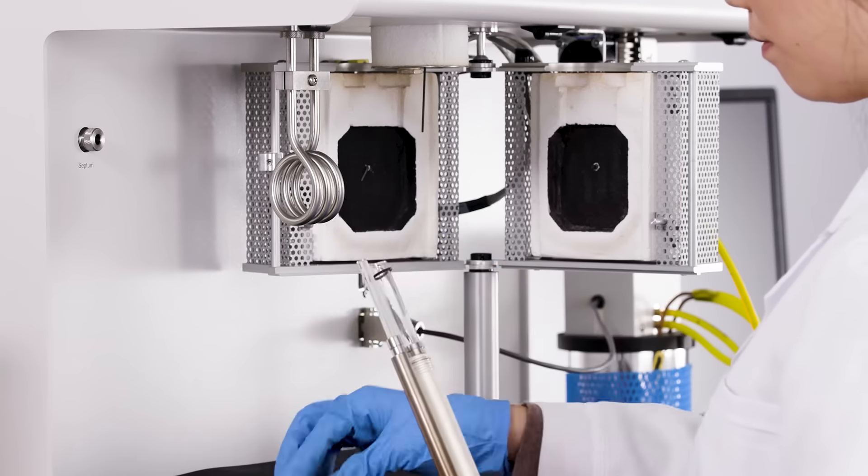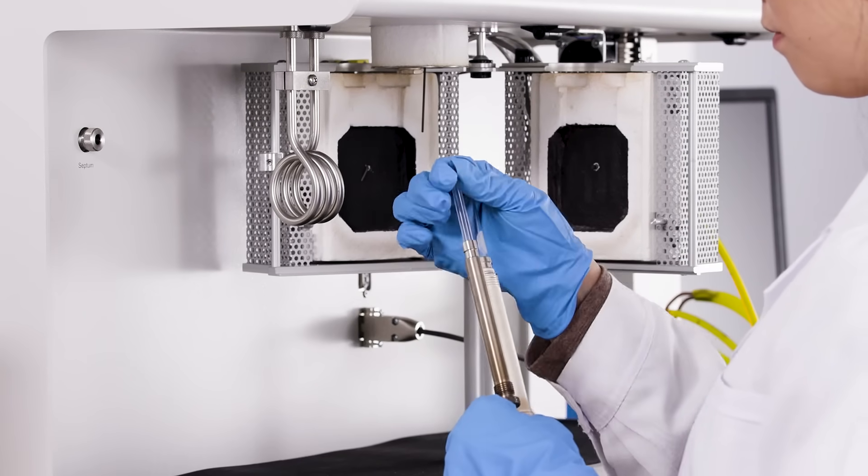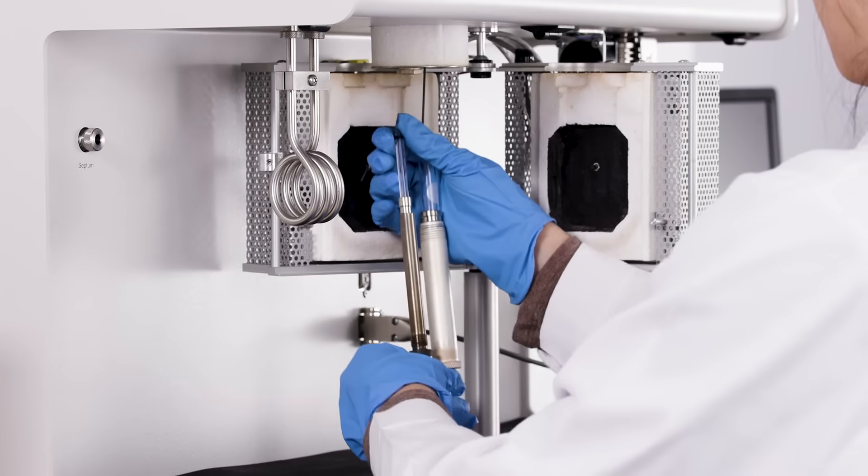Check if the O-rings are clean and free of debris or cracks to ensure a good seal. Replace them if there are any defects found.